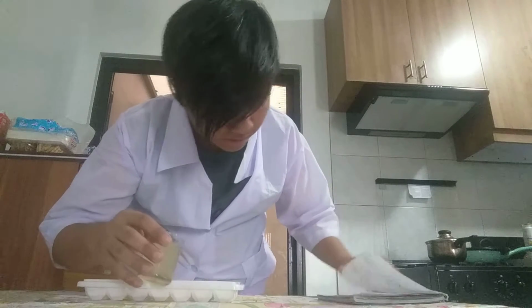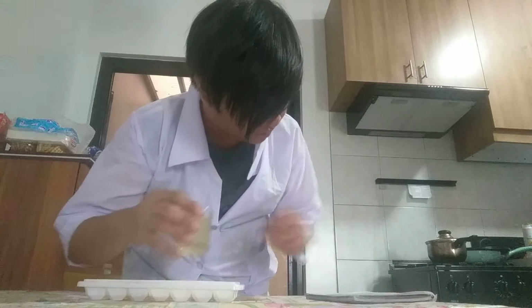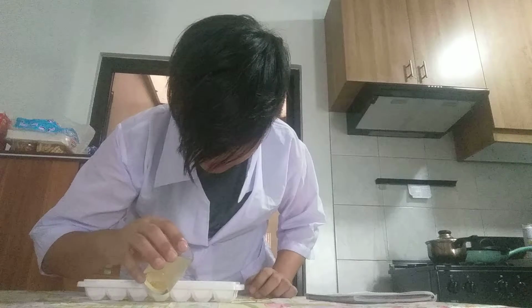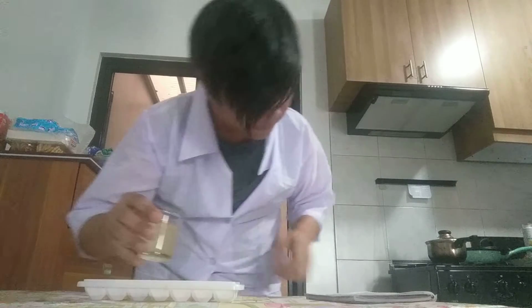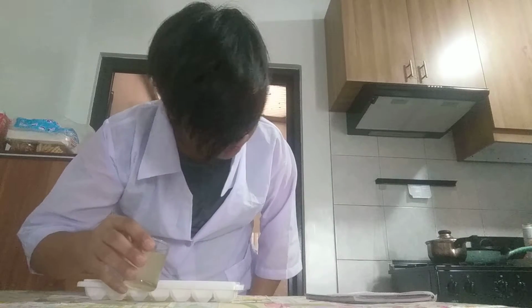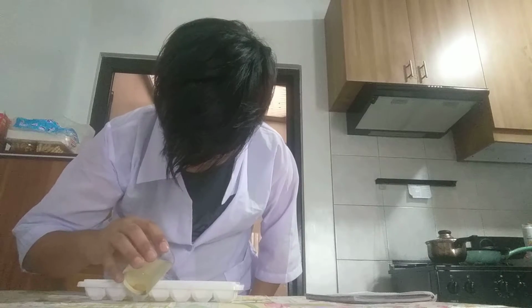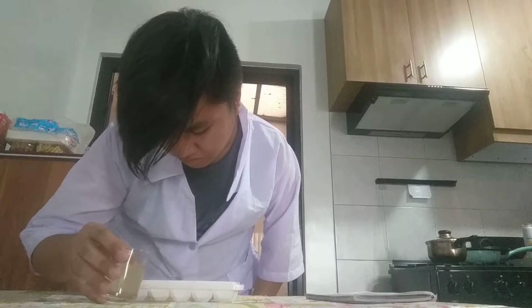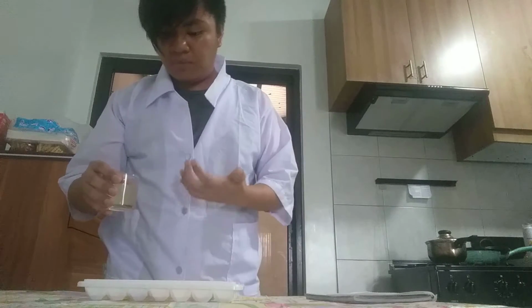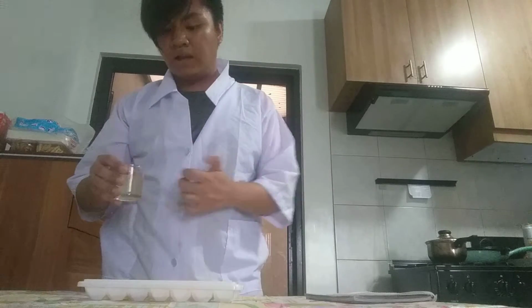Okay, so we add here the carrot juice into the drinking water. Okay, it's a pretty transparent color. Next up, the milk. Yeah, actually the color of the milk was mixed. It's a bit transparent, like when you're adding water into milk, you know that color, the transparent, whitish color.